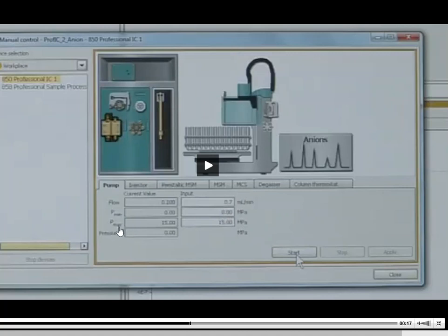The P max is the maximum pressure before the machine cuts itself off. This helps prevent some damage to the machine. If there's a clog or something going on in your column or in a tubing line, and this begins to build up pressure and it goes higher and higher, it can blow. And when I say blow, I don't really mean an exploding machine on the countertop. What I do mean, though, is the PEEK tubing will begin to explode. Maybe it will begin to leak. Your column can get damaged, and the conductivity cell can also get damaged because of it. So this pressure max, I never really change. That's a default setting from the instrument company, and I really just leave that as it is.